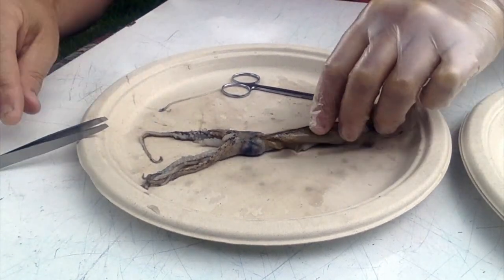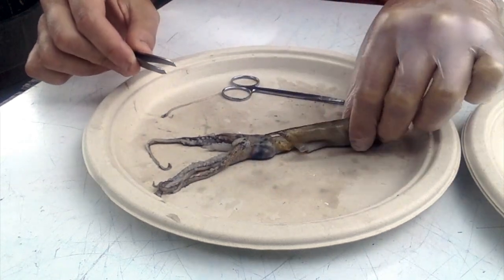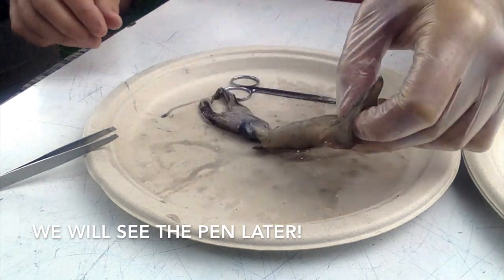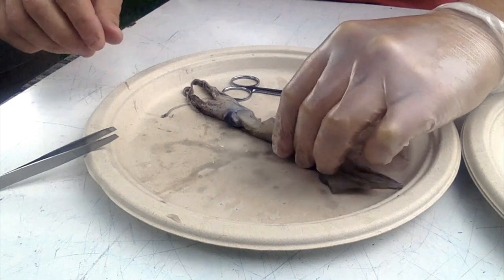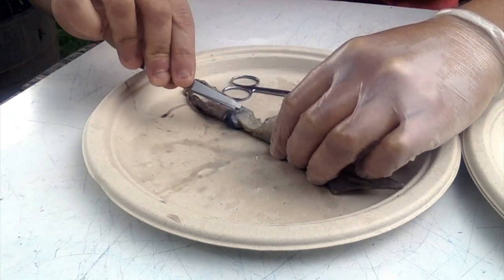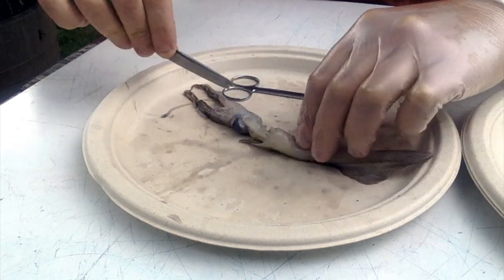So, another thing I'm going to point out is that there's this rigid structure here called the pen, and we're going to pull that pen out in just a second. To start my dissection, I'm going to flip the squid over so that the siphon is on top. So here's my siphon. Hello, siphon. And here's the mantle.